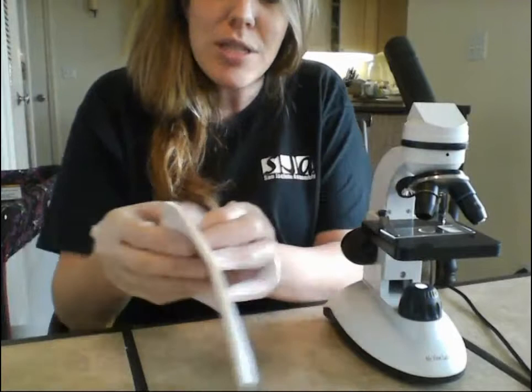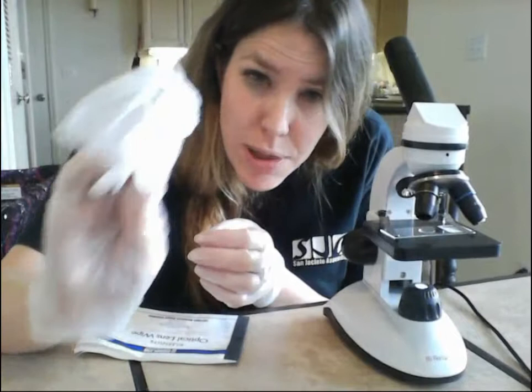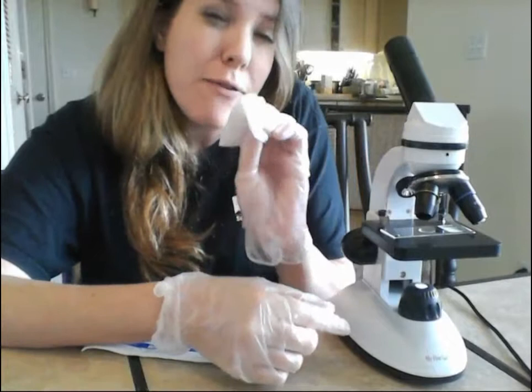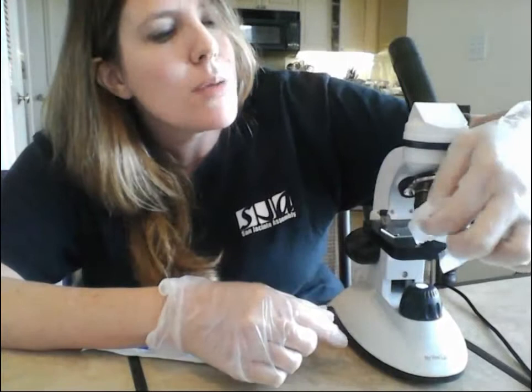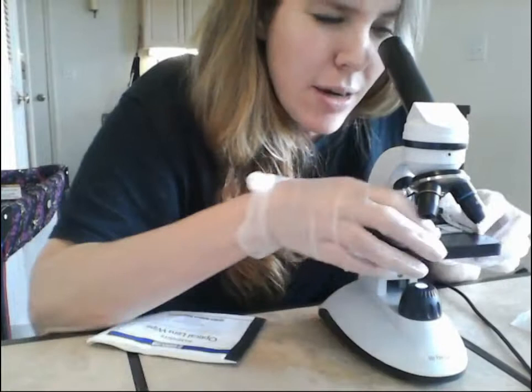Here's your optical lens paper — you just need a small piece. It's always a good idea when you get started and before you leave to wipe down your lenses. Always clean your lenses with lens paper — never use paper towels or toilet paper because they're not soft enough and they'll scratch your lenses. These are specially designed for microscope lenses. Clean your ocular lens, your objective lenses very gently, and the lens above the light.